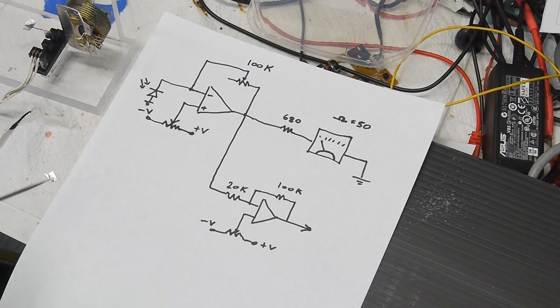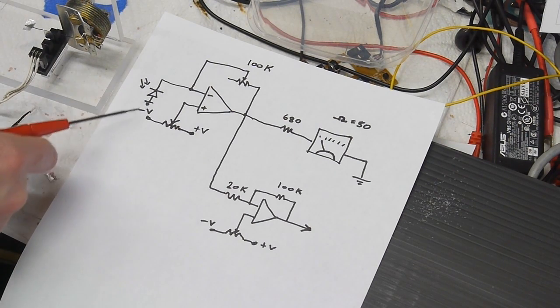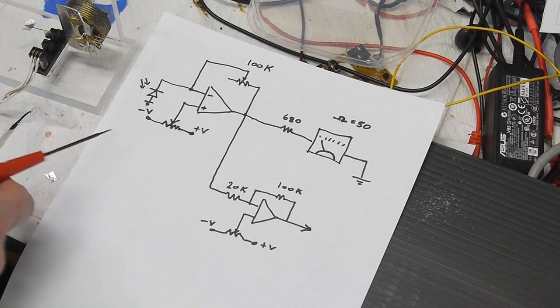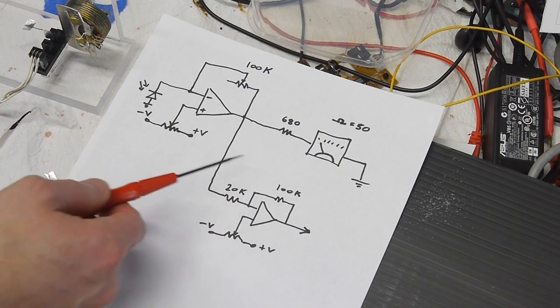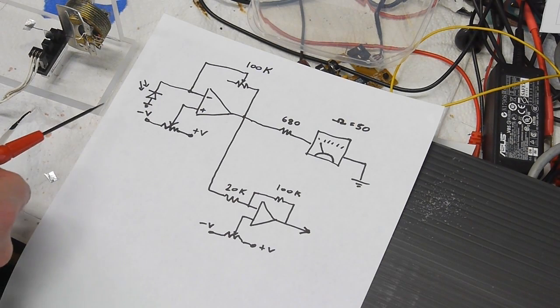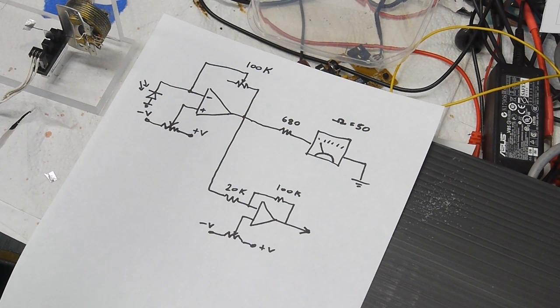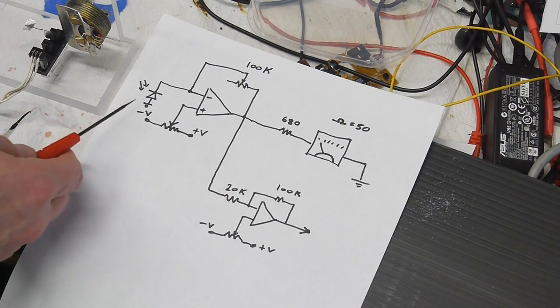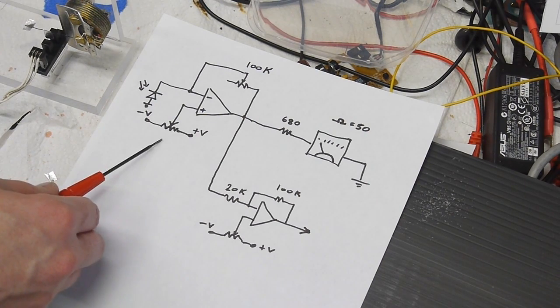Here's what the circuit looks like. We've got the photodiode here so that when light is shining on it, it will pass some current in the reverse direction. And the output of this op-amp circuit is driving the meter. And so what we have here is a servo loop so that when the light beam is blocked, it sends more current into the meter and pulls the needle up. And then when there's light hitting this, it tries to pull the meter back down. So it's constantly servoing so that the photodiode receives just the right amount of light. And that just the right amount is set by this pot over here.